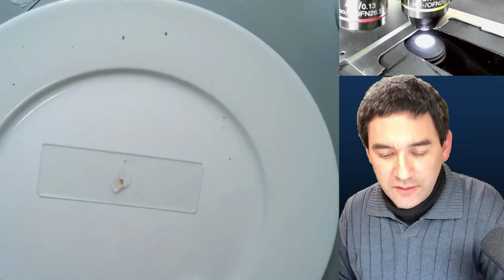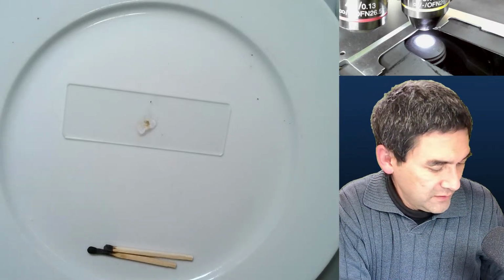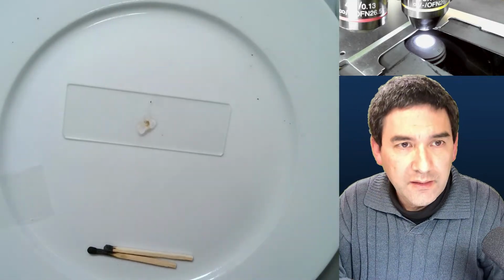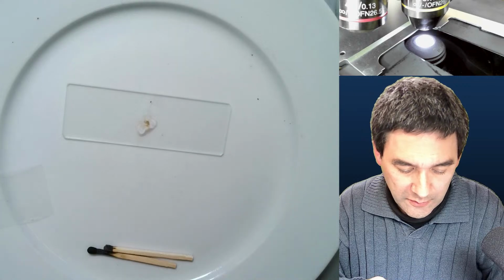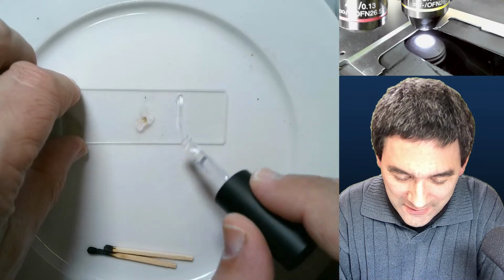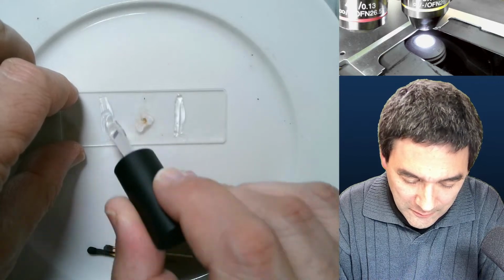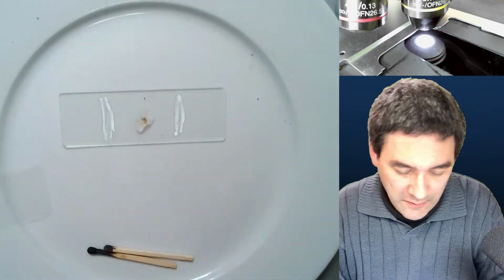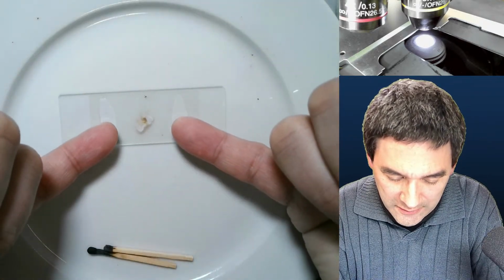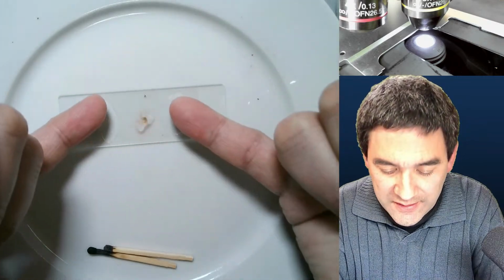Now I can actually, yeah. And I'm going to now take a cover glass again. I'm going to then also take again some of this nail gel. This time I'm just going to do it like this and like this. This goes on top. Carefully press down a little bit. Because it's a gel, it's very viscous and it will not touch the central part.